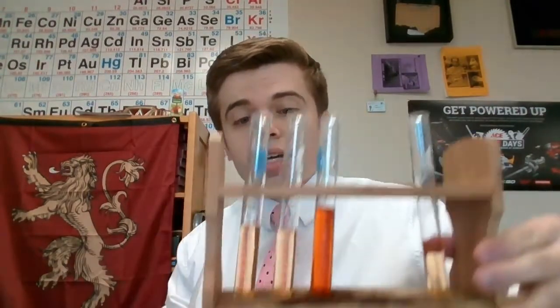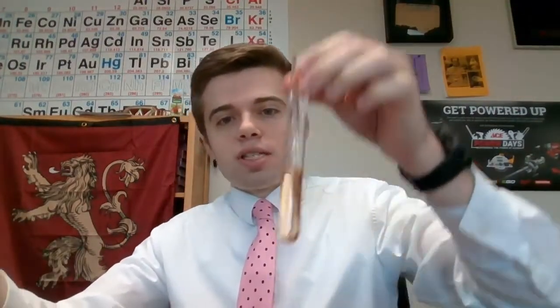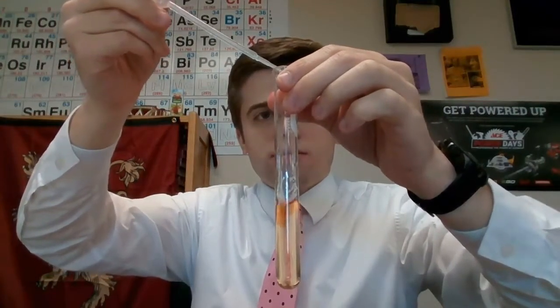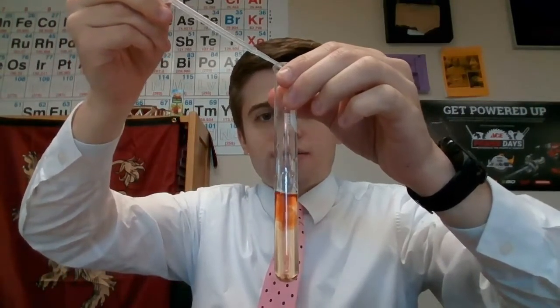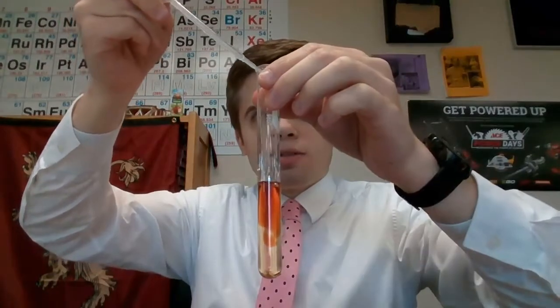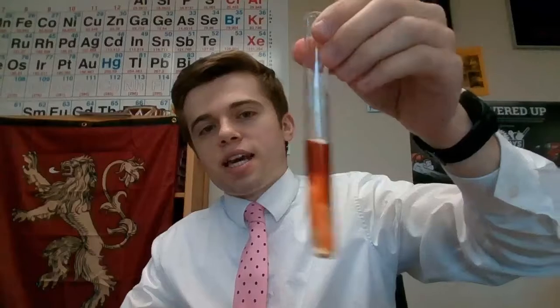So next, to test tube number 2, so this one right here, we're going to add the potassium thiocyanate, I believe that's how you pronounce it, which is that KSCN. So I'm going to put it in this pipette here, and I'm going to hold this up so you can see, and we're going to add 20 drops of this to our solution. 5, 6, 7, 8, 9, 10, 11. Maybe we'll do a little bit more than 20, because why not? This is chemistry. We're supposed to be a little crazy, have some fun.